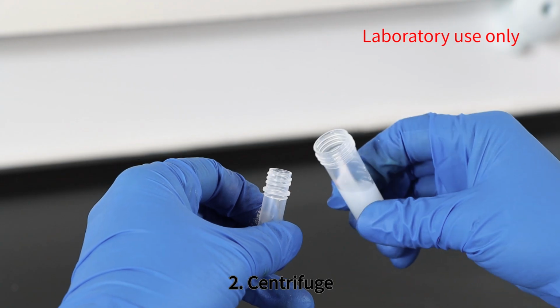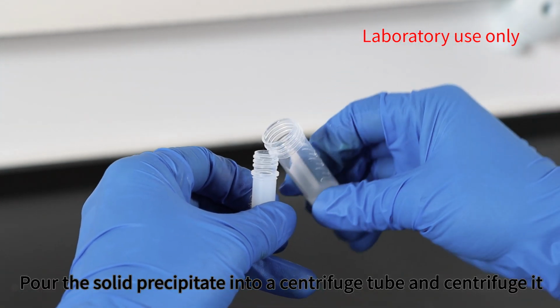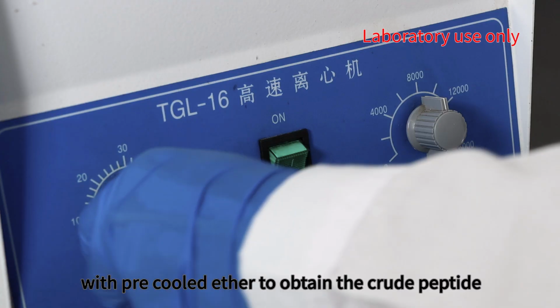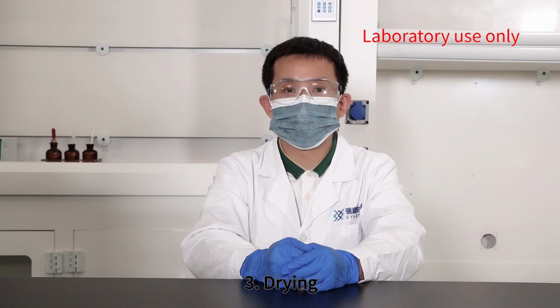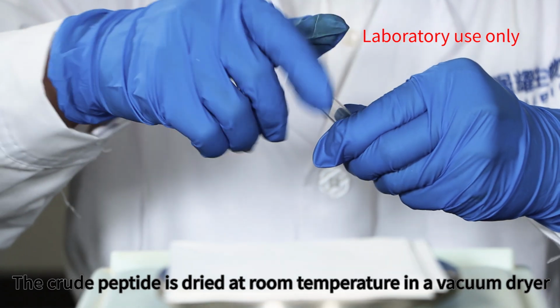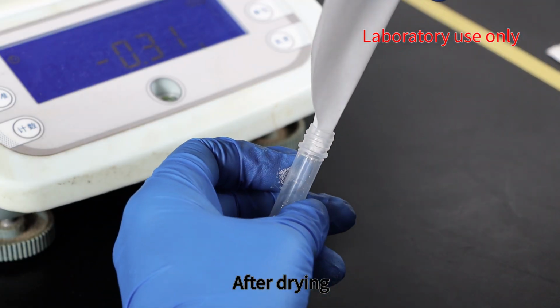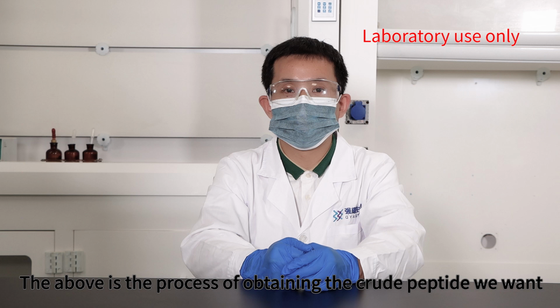2. Centrifuge. Pour the solid precipitate into a centrifuge tube and centrifuge it. Wash it 3 times with pre-cooled ether to obtain the crude peptide. 3. Drying. The crude peptide is dried at room temperature in a vacuum dryer. After drying, the weight of the crude product is measured and labeled. The above is the process of obtaining the crude peptide we want.